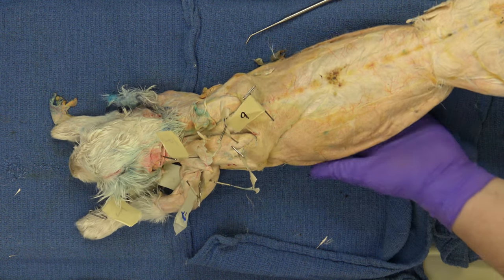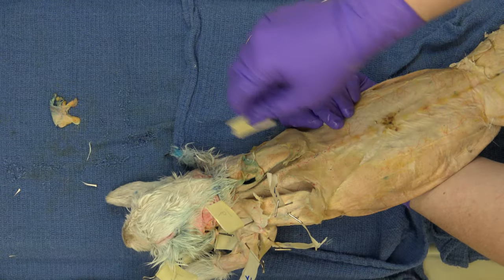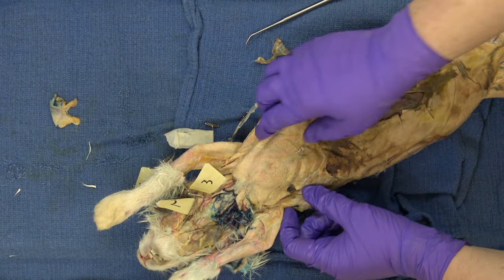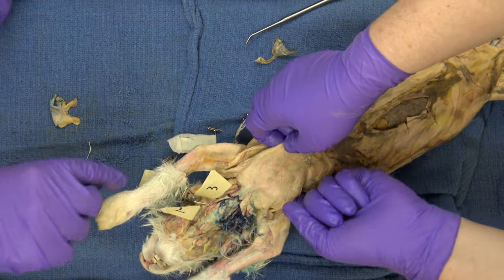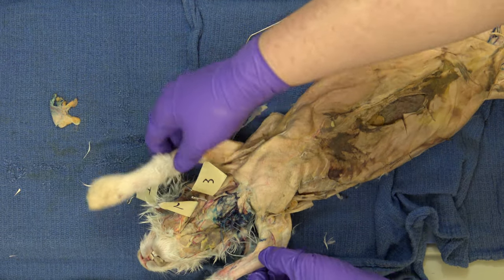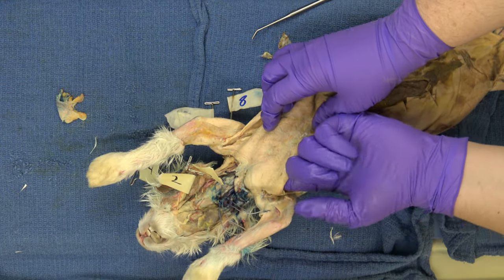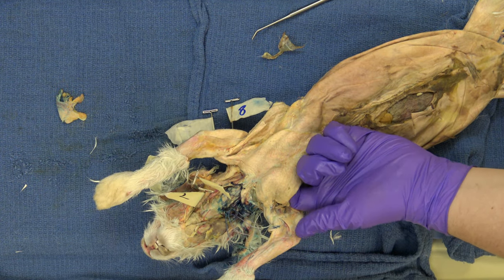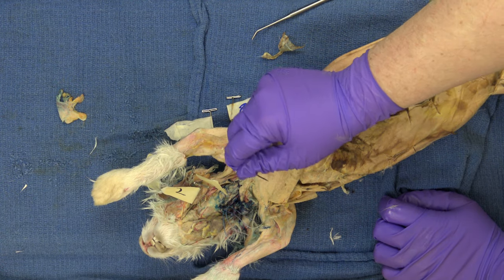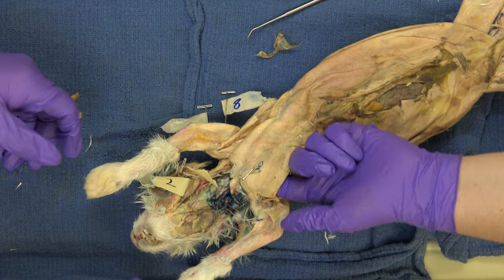Now another muscle you're probably familiar with — the pectoralis. This muscle, the pecs, is the muscle that is allowing your arm to move like this. Pectoralis — right here. This is a giant muscle. Birds fly with it — this is, you know, chicken breast. Huge muscle right here — pectoralis.